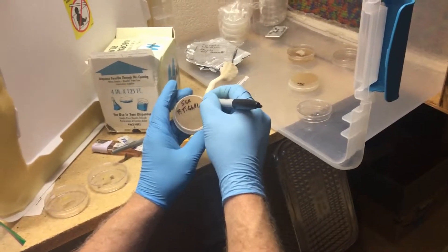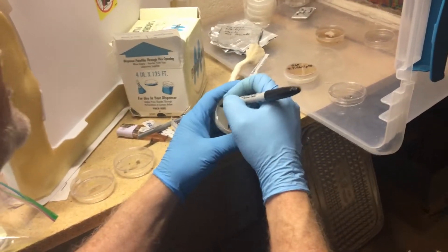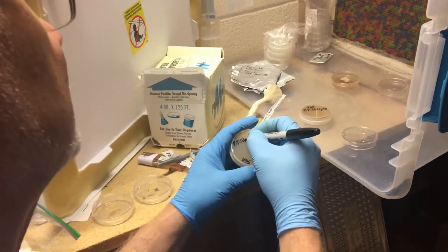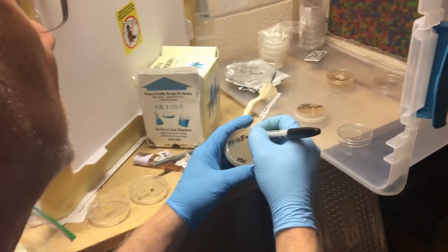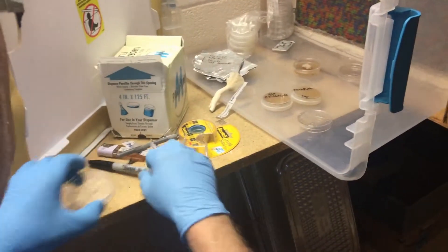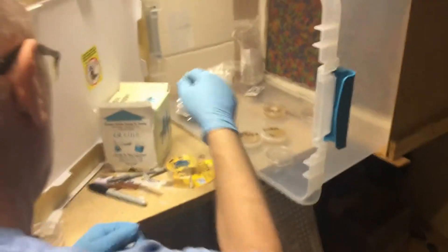I also tend to put a P number on the label. This would be P00 — in other words, first generation. If I transfer it to a different culture, then that becomes P01. That way I keep track of what the generation is for this particular strain, and I can start being aware of any problems with senescence of the culture.